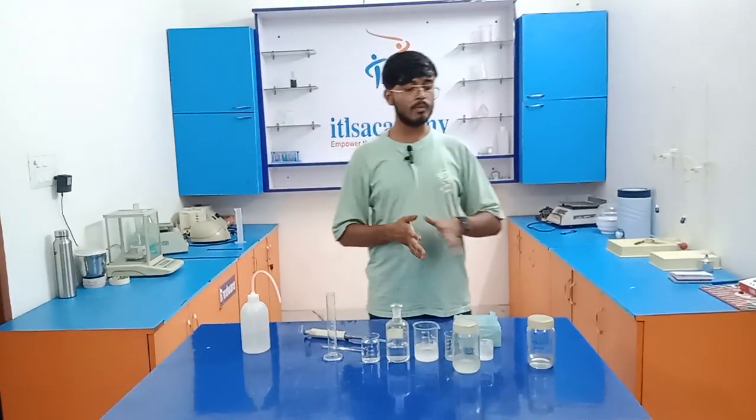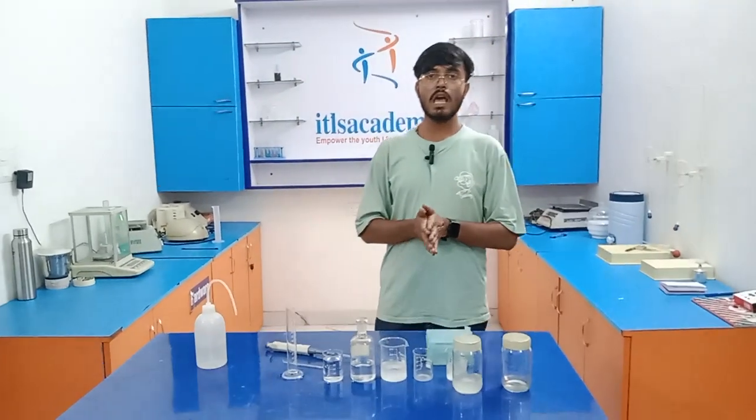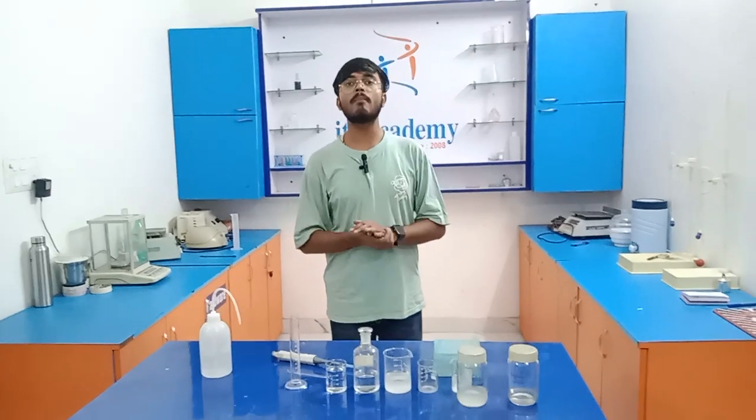So this is how we prepared the magnesium sulfate solution and barium sulfate solution. Hope you understand this.